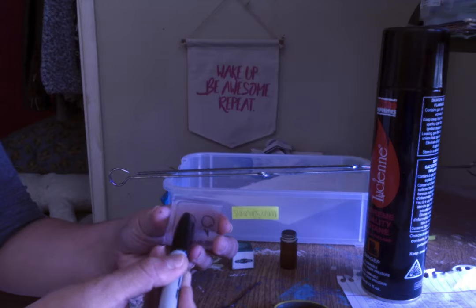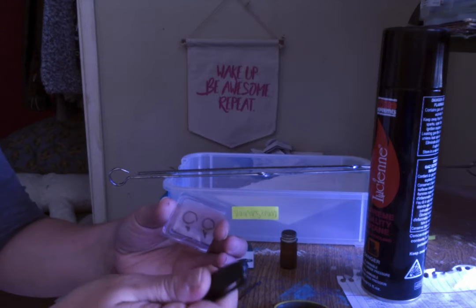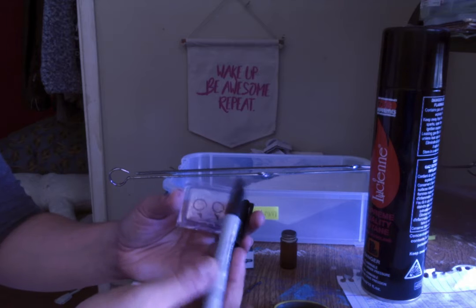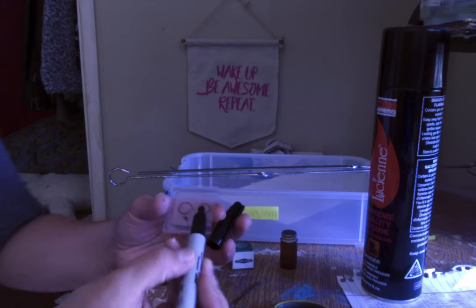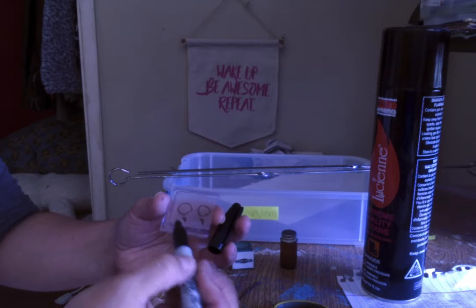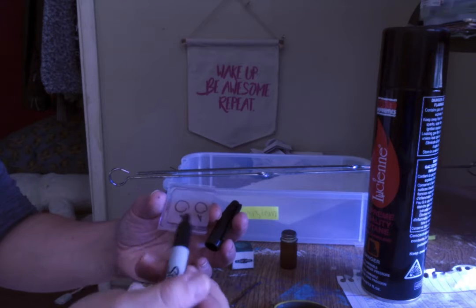Make 2 circles. You never want to put more than 2. You can put it on separate slides. You can put it on the same slide. But if you put more than 2, it begins to look jumbled and it'll just be a big mess. So on the back, you'll put 2 circles. That way you know to put your small smear in there. And you will label them.